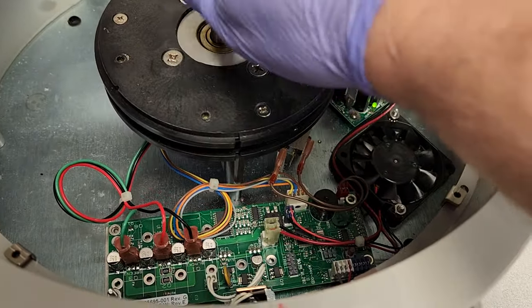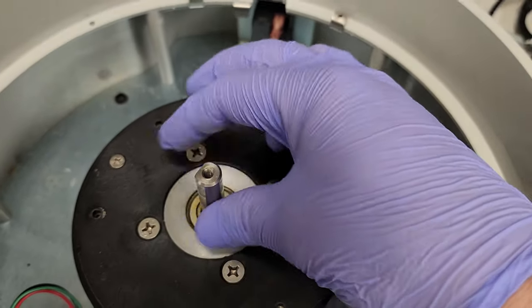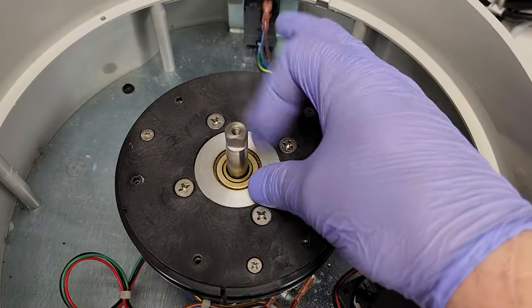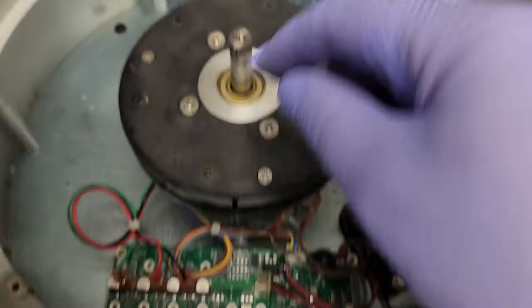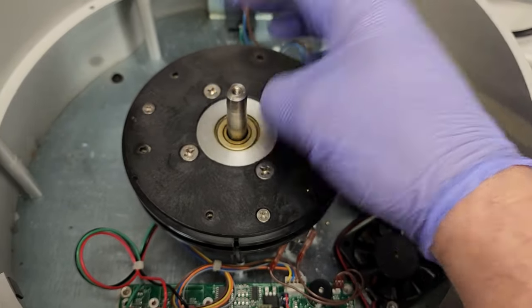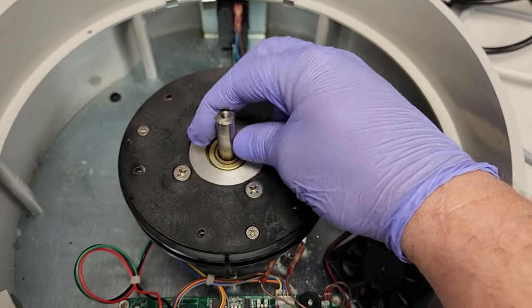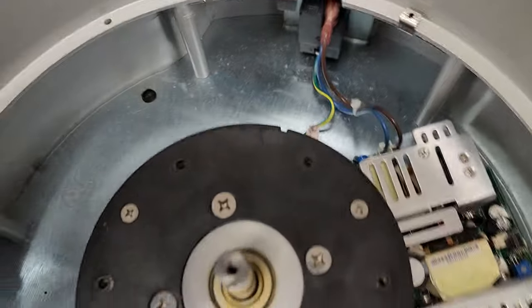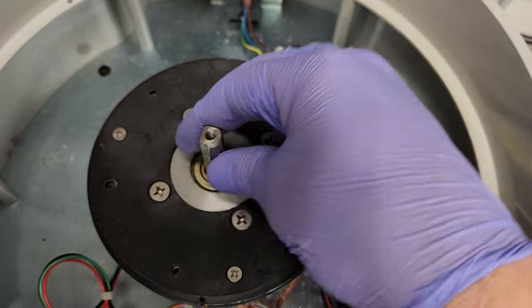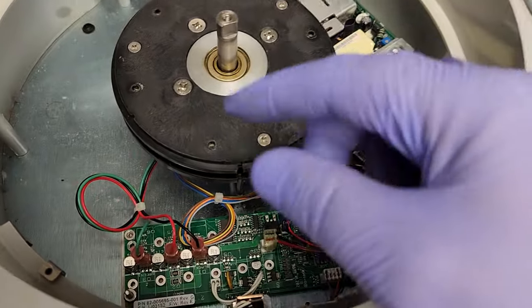Since it was a motor error, the first thing I do is power it up — and you can see right here the motor is kind of difficult to spin. So I disconnect the power and look at this — I can spin it really easily. That is because three-phase motors, when they're semi-energized, those coils are going to resist a change in the magnetic field, which is why it resists the rotor rotating. Plug it back in — and yep, it's tough to spin again.